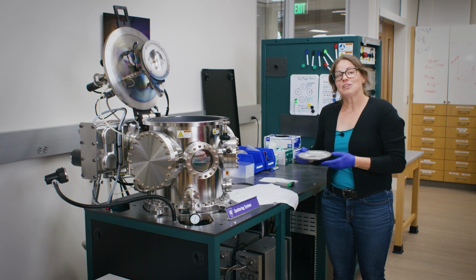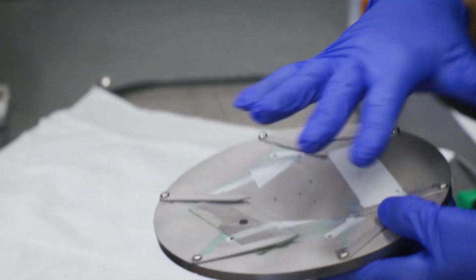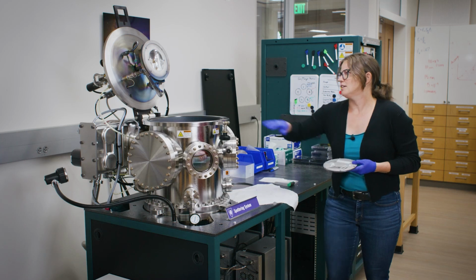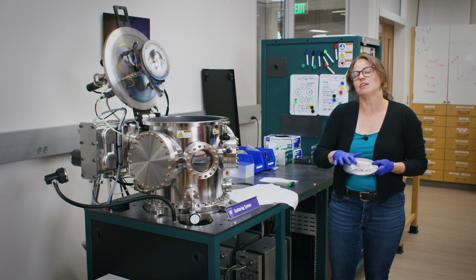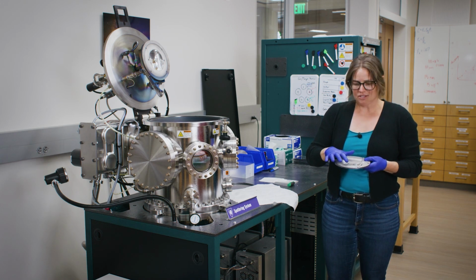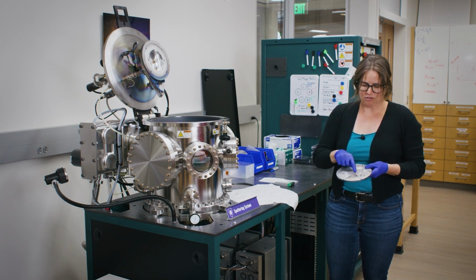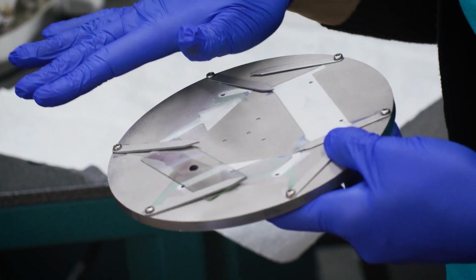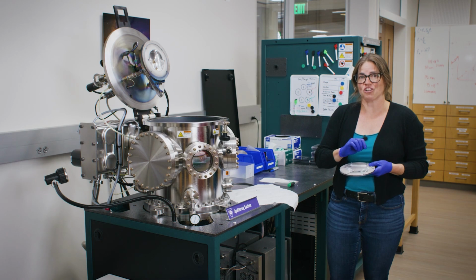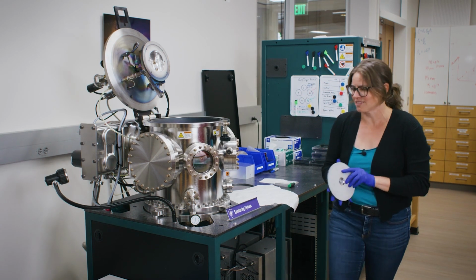Okay, so now I'm going to actually load what we call the substrate, which is what we deposit on, into the chamber, and I'm going to load it on top of the substrate heater. Today I'm going to be depositing on a microscope slide. Since we're just doing an example film today, you'll notice the black Sharpie dot, which is useful because after we deposit, I can remove the Sharpie and actually measure how thick of a film we've deposited.